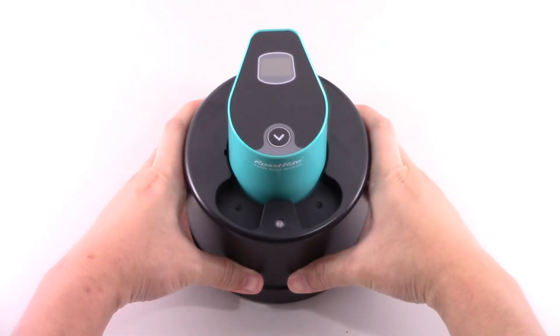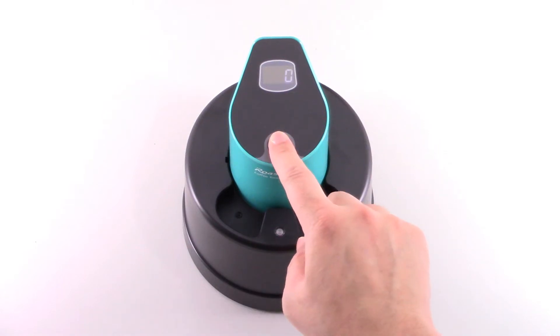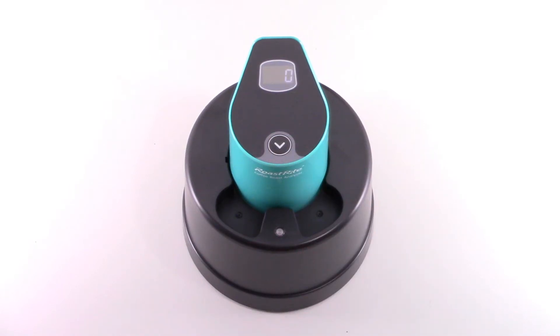Cover the sample plate with the analyzer and the bigfoot. If the display is dark, press the button once to wake up the device from power saving mode. Press again to start the measurement — the result will be displayed on screen in a few seconds.